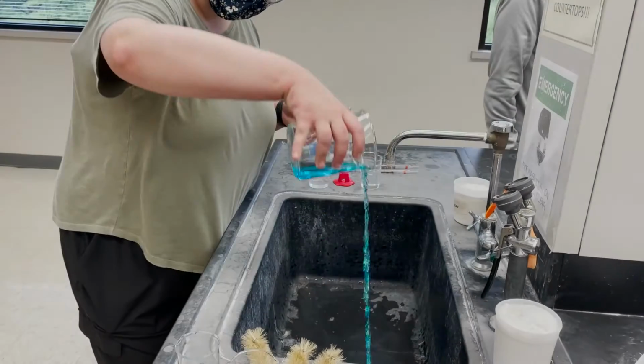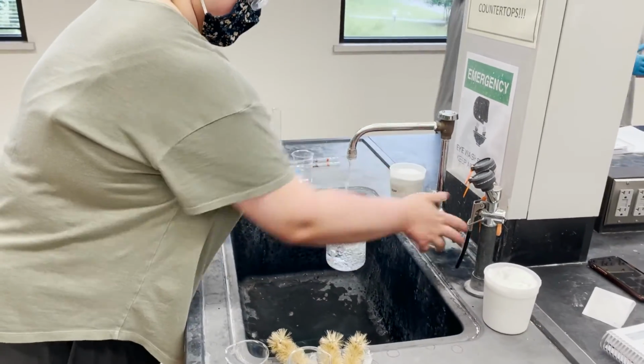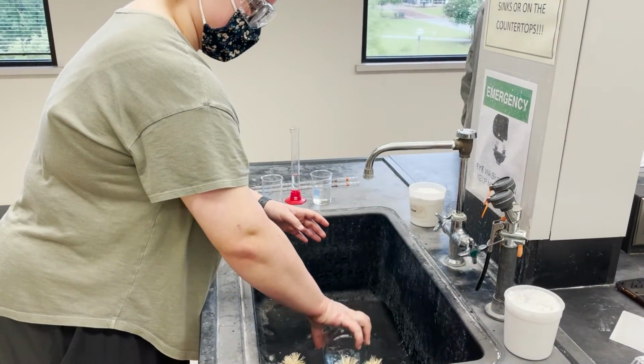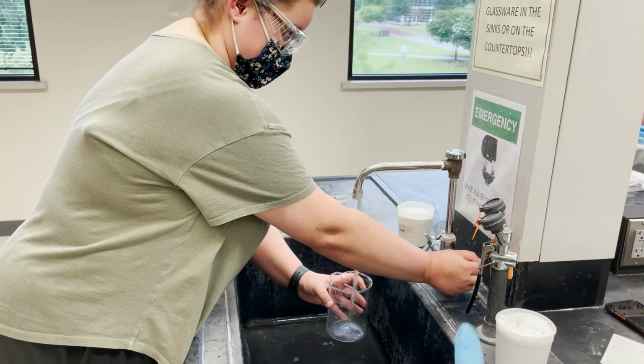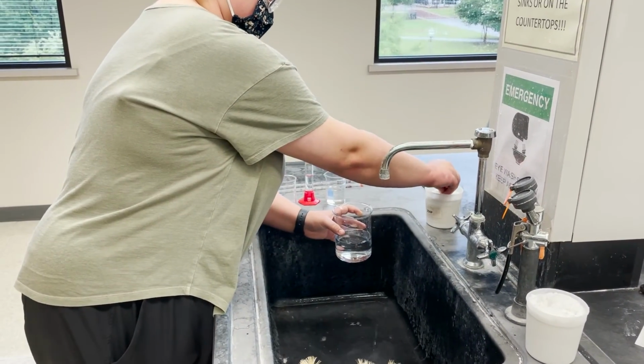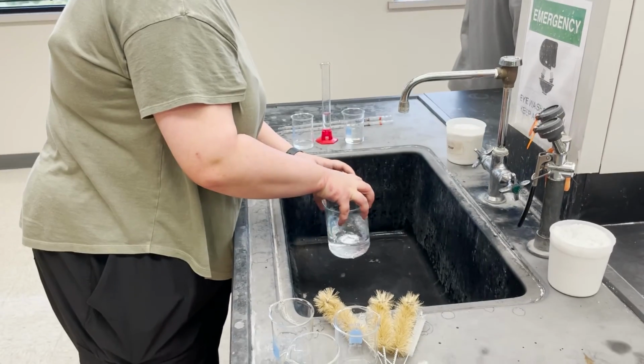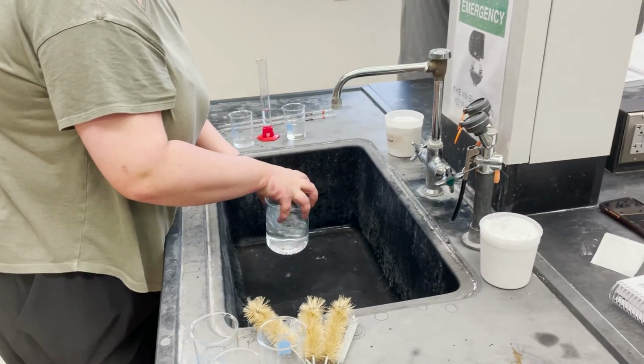To clean up our workstation, wipes were used on the desk surface. Any and all instruments used throughout the previous experiments are brought to the sinks where they are then emptied and rinsed. Any container that was used to hold a solution other than water will be washed with the powdered soap provided in the lab, and the scrub brushes provided can be used.